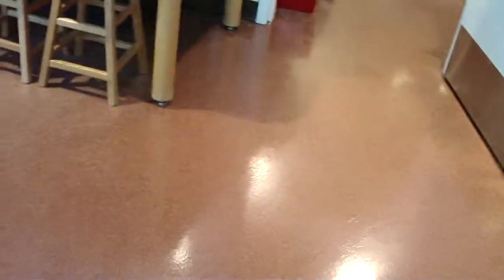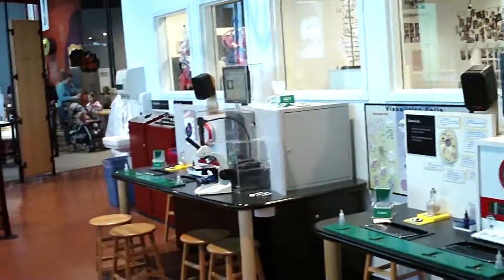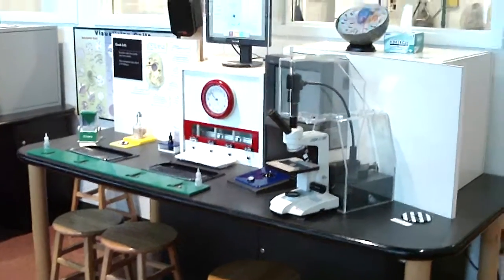This little place is called the cell lab where you do different types of experiments. Right here are cheek cells where you find the nucleus of that cheek cell. Kind of a fun experiment.